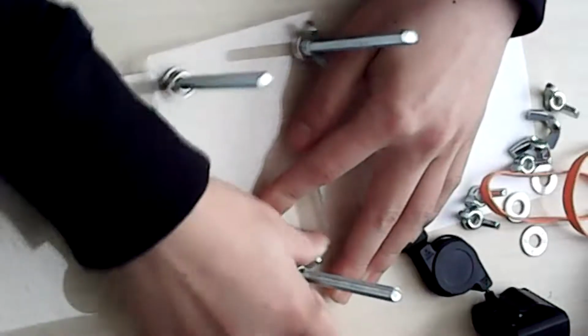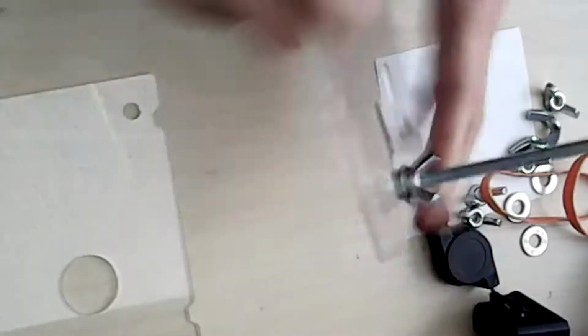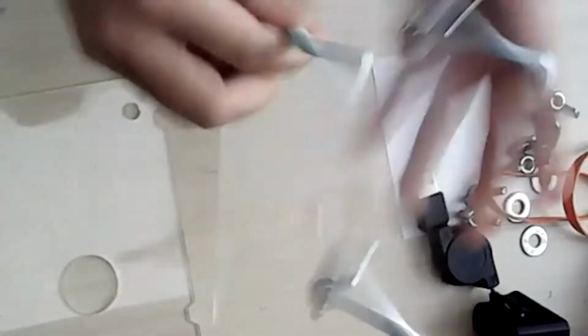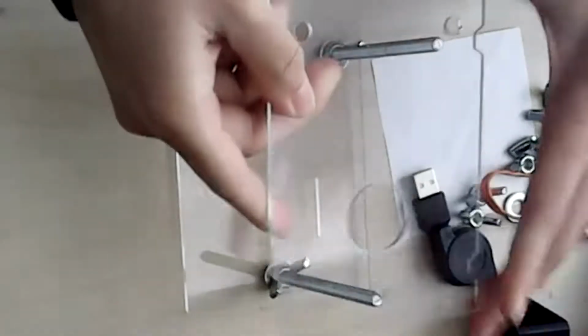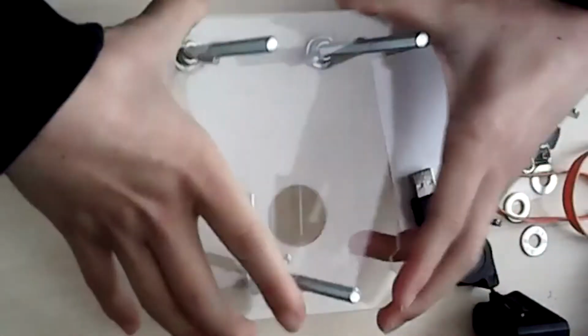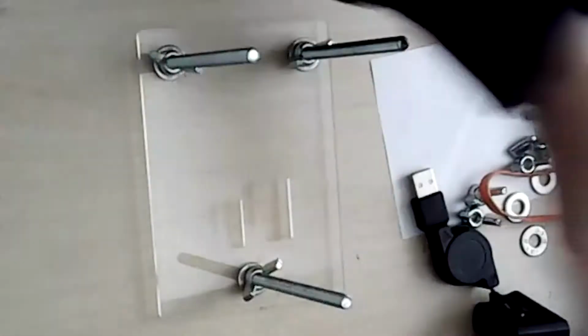Once we have these nuts secure, just tighten them, and then, yeah, it seems pretty tight. It's not gonna fall off. So next thing is you will put this other stage on top.